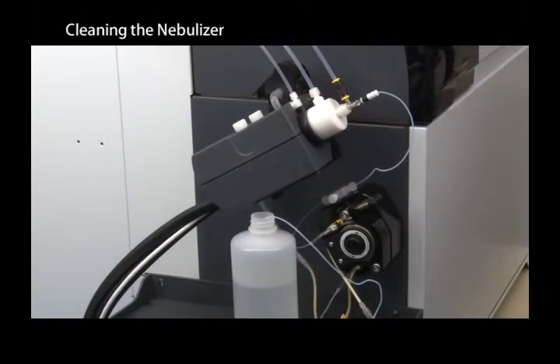For normal cleaning, place your nebulizer in a 5% nitric acid solution. Leave micro-mist nebulizers for about 10 minutes and PFA nebulizers for a few hours, or until the monitored signal drops to the required level. If the nebulizer is clogged, first watch the video on removing nebulizers and then follow the steps in this video.